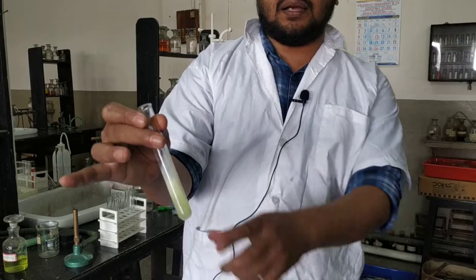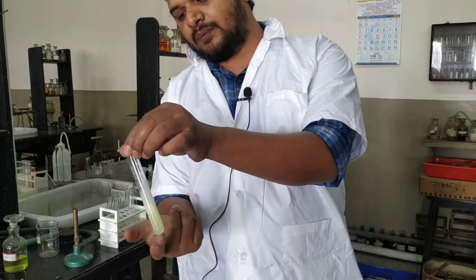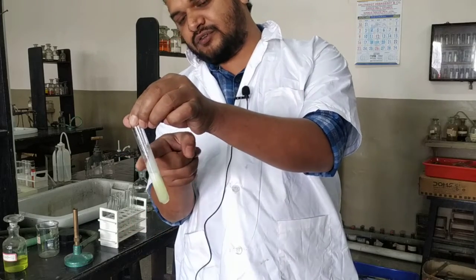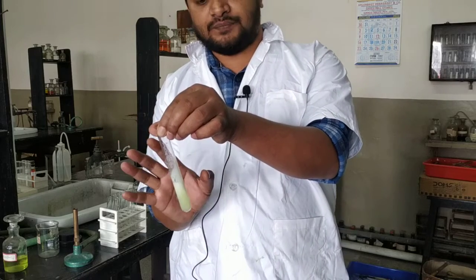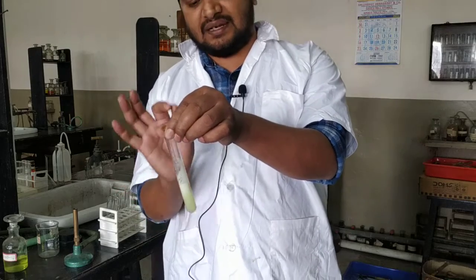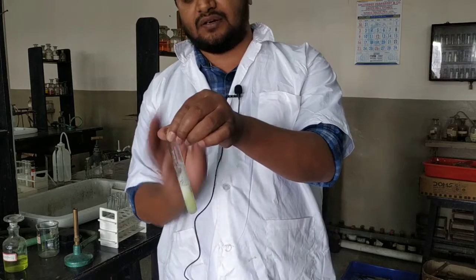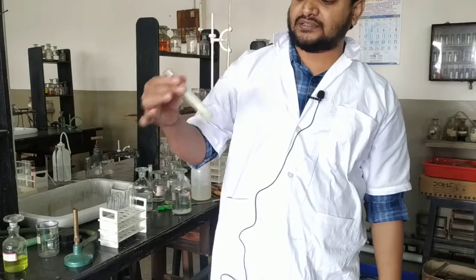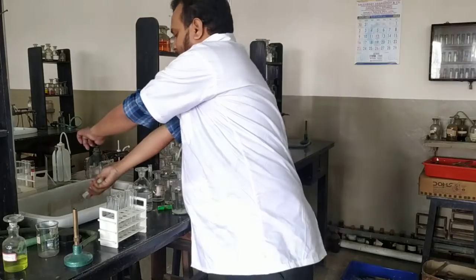It may appear a little bit yellowish because potassium ferrocyanide is yellow, some liquid potassium ferrocyanide is there at the bottom, but if you look at this part, the color of the precipitate is bluish white. If you are not sure whether it is bluish white or not, you can filter it and then see the residue on the filter paper. There it will be confirmed that it is bluish white. Okay. So these two tests confirmed that the group 4 cation present in this salt is zinc 2 plus.